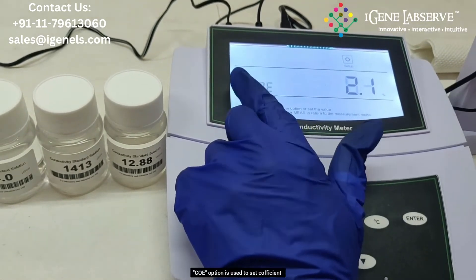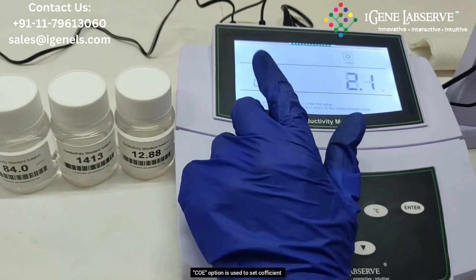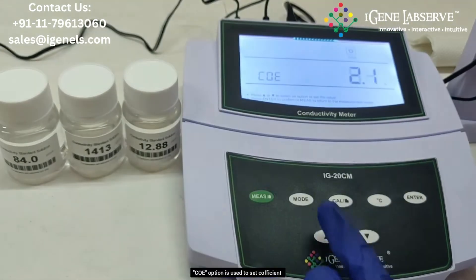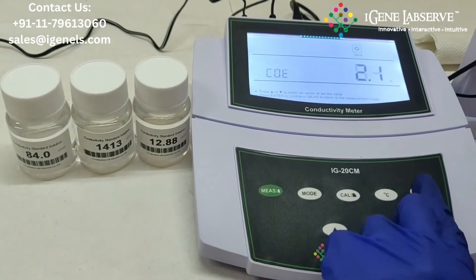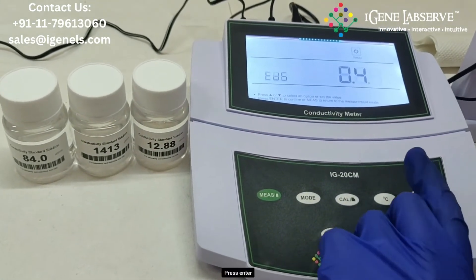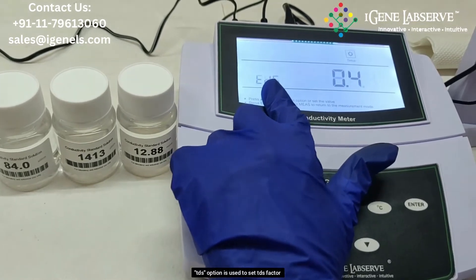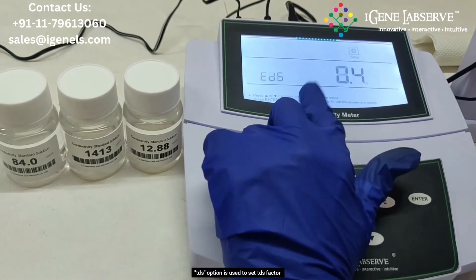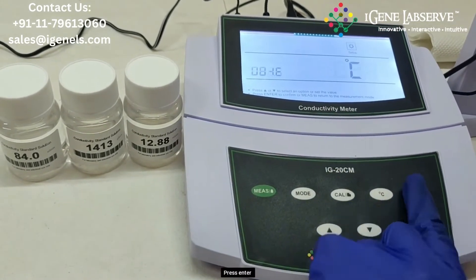It goes to the next parameter, which is the coefficient. You can set the coefficient using this option, then press enter. This is the TDS factor — you can set the TDS factor using this option, then press enter.